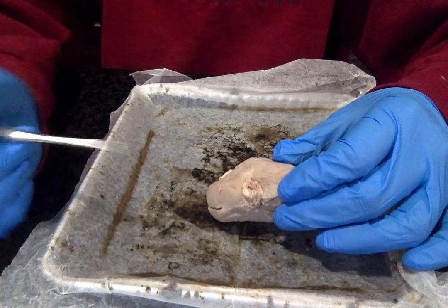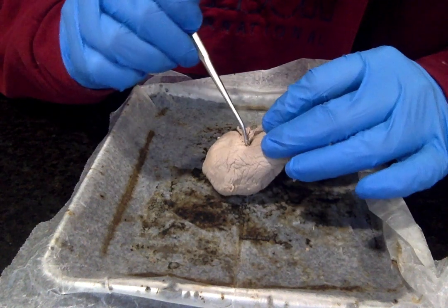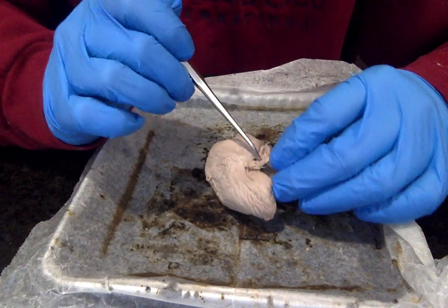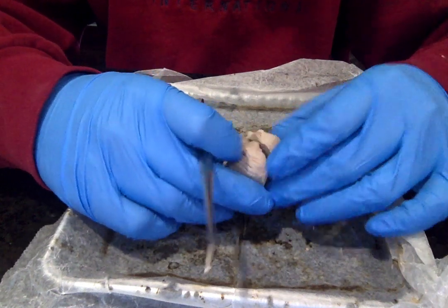This is where the blood vessels that exit the kidney are carrying filtered, deoxygenated blood back to the inferior vena cava. And then this hole right here is the ureter. And the ureter is the tube that connects the kidney to the urinary bladder. It's been cut off though for dissection purposes.